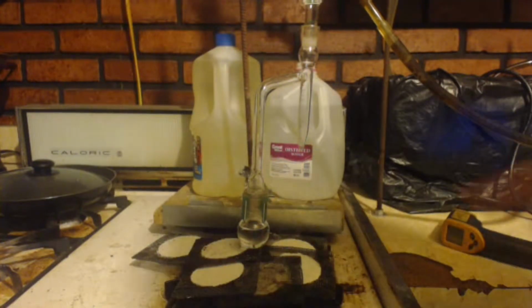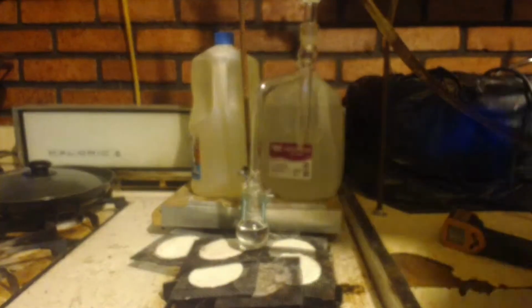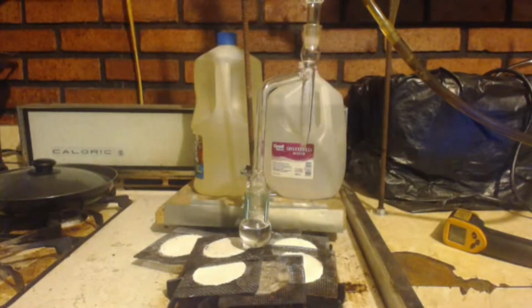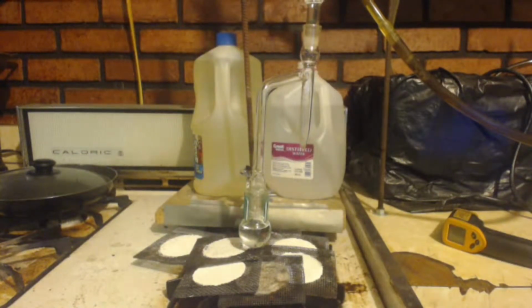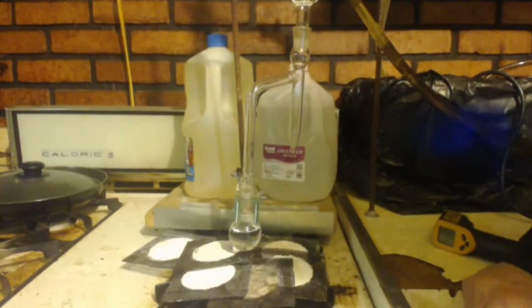So I'm going to put this back in the Dean Stark apparatus, this azeotrope one, and just see if I can get some more water out of it. Alright, so I got the bigger quantity here, the one that's the azeotrope, right? That is filled up way too much. You should never fill up a flask more than halfway, but I'm just like, screw it. We'll see how it goes.